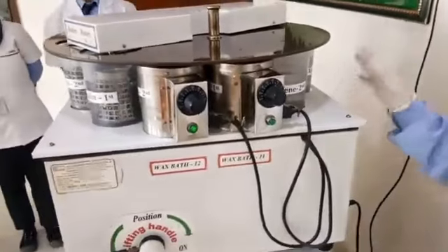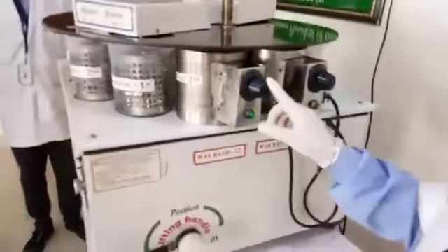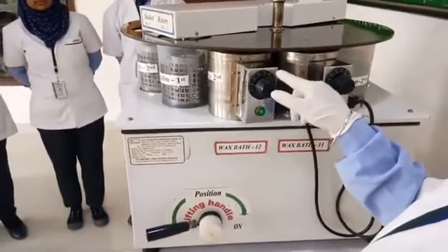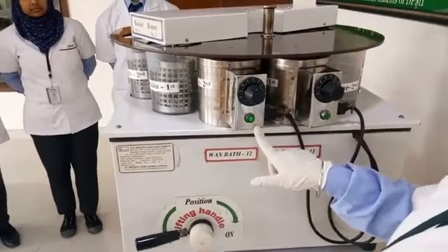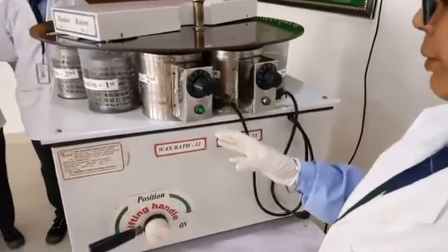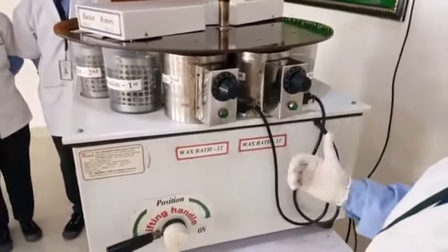After clearing, our next process takes place in the wax bath. Wax bath has knobs which help to maintain the temperature, and wax bath temperature must be between 50 to 60 degrees Celsius. As the temperature attains 50 to 60 degrees Celsius, the indicator indicates that temperature has been attained in the wax bath. In the wax bath, during infiltration, the xylene is eliminated into the surrounding melted wax, and afterwards the wax is diffused into the tissue, which is known as impregnation.